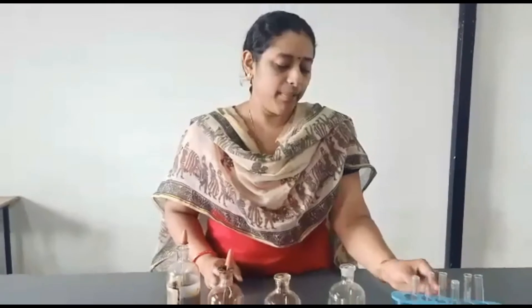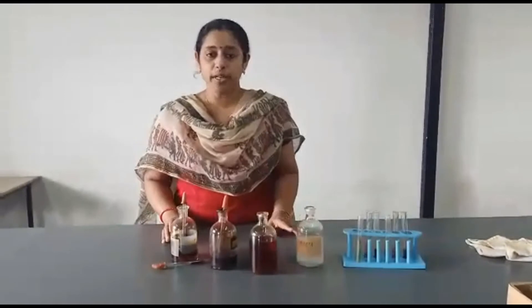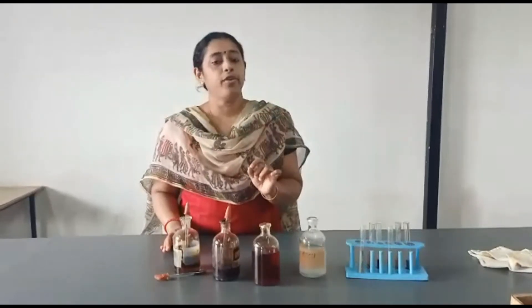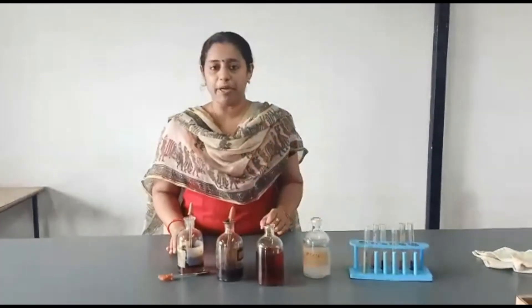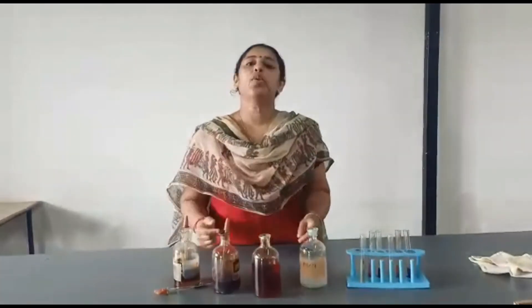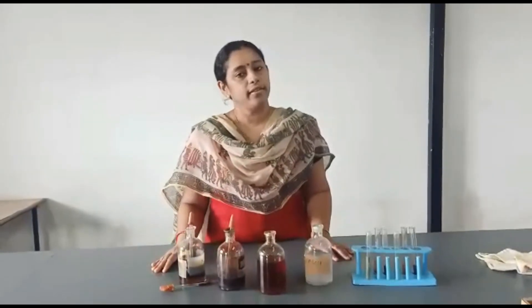So this is the biochemical test for starch. Today I have performed two tests. First, the Iodine Test — I took 3 ml of the starch solution, then added 2 drops of iodine solution, and we got a bluish-black precipitate. In the second test, the Ring Test, I took 3 ml of the starch solution, then added 2 drops of alpha-naphtol and then concentrated H2SO4. Then in the middle you get a ring — that is called the Ring Test. Thank you.